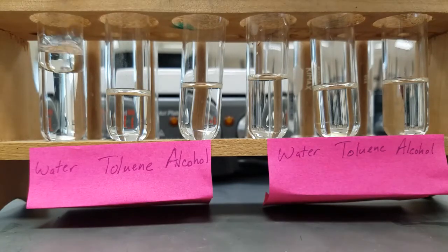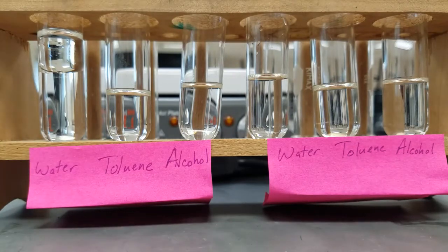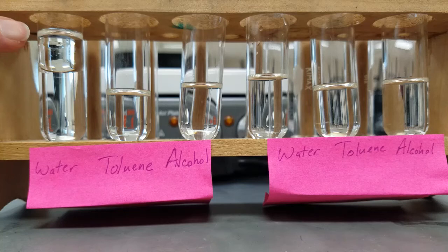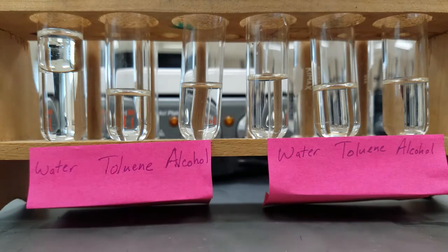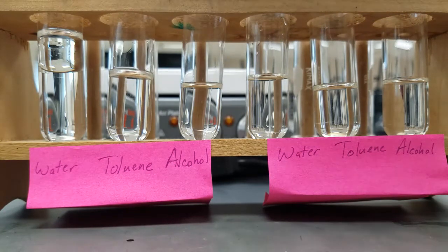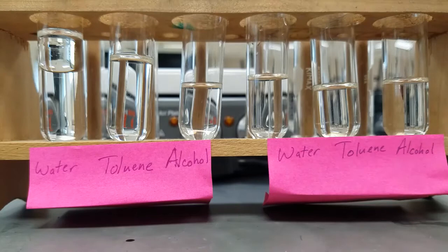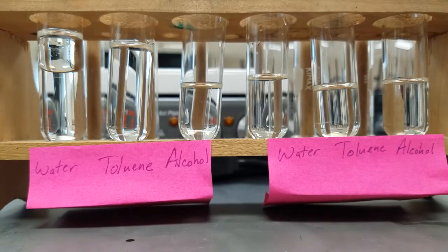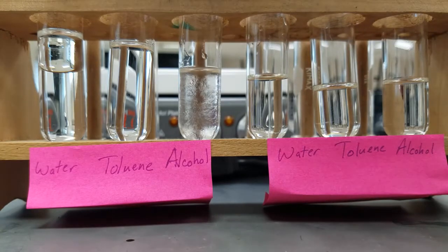For liquids, if it is insoluble there are two distinct layers. You'll see the water on the bottom, the xylene on top, and there are two distinct layers. If they are soluble, you do not see the transition between them — they just thoroughly mix. Our toluene and xylene are soluble.